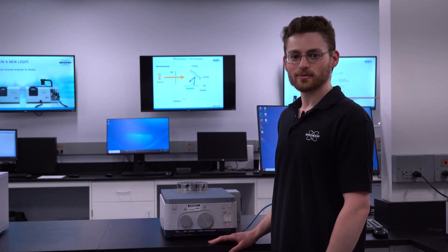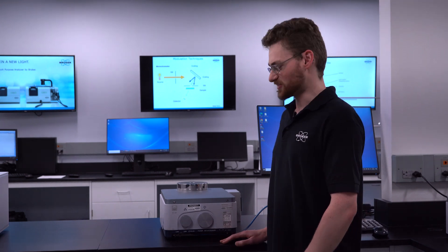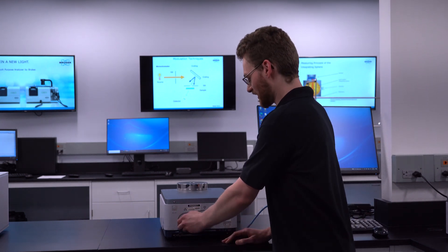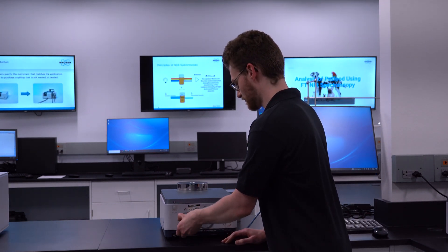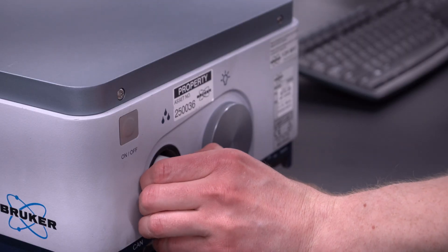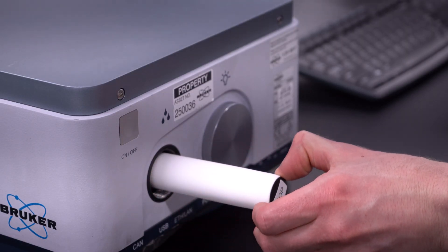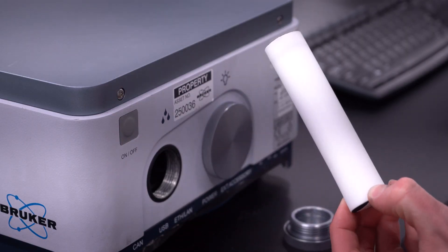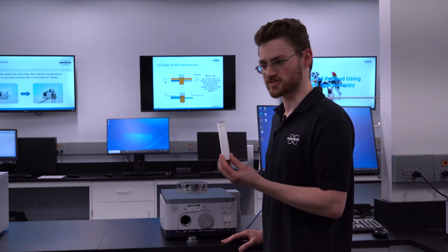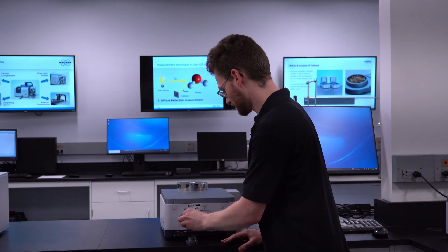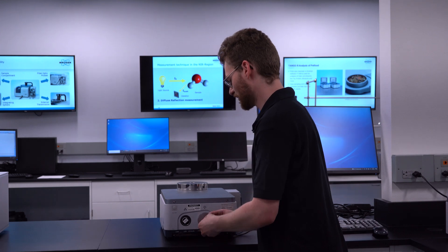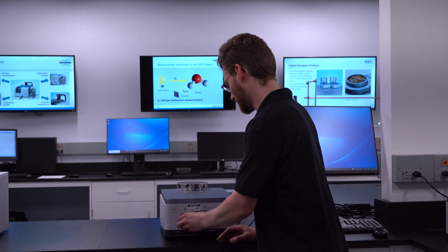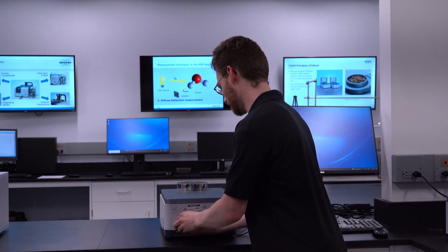The Tango will let you know when it's time to replace the desiccant. It's as easy as unscrewing the cap and pulling it out. We recommend that you have two desiccants so that when you take out one to regenerate it, you have another that you can simply put in so you do not lose any time and screw back on the cap.